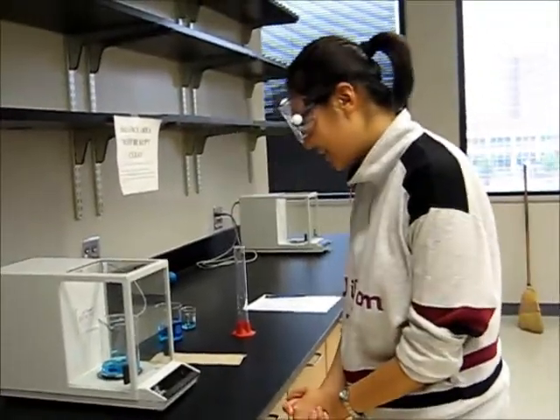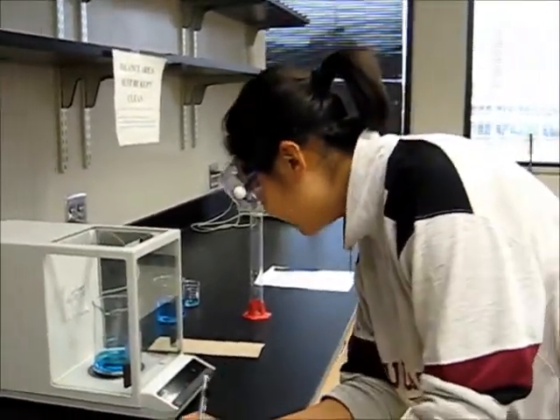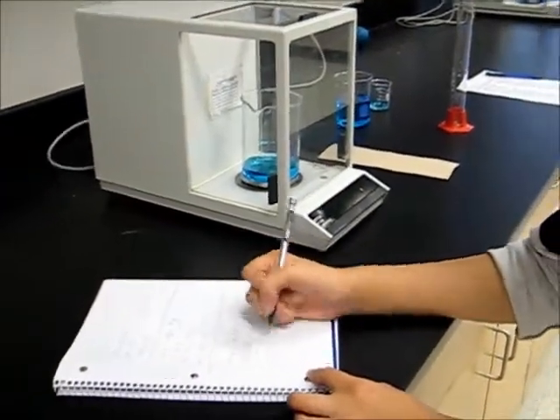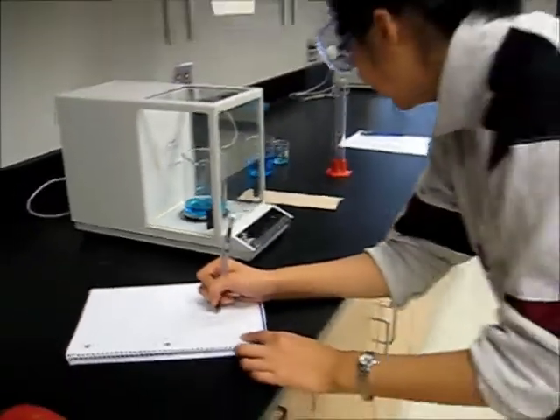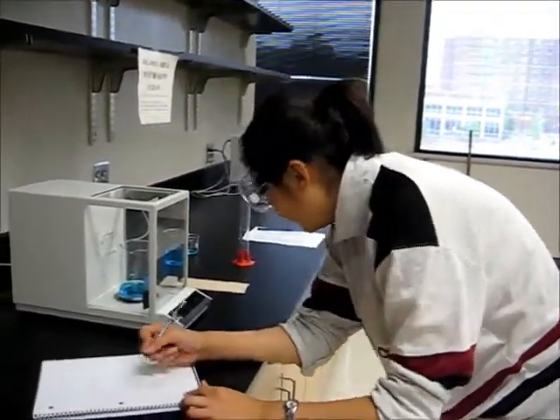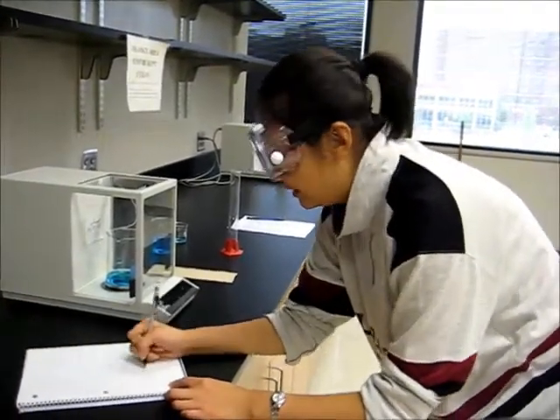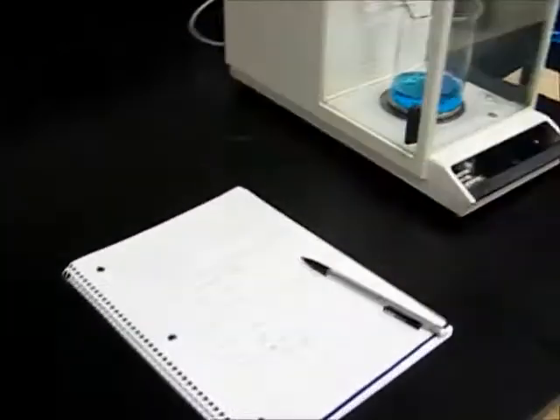And in this case, it's 189.389. So this should be our final mass, 189.388. And this will be our final mass.